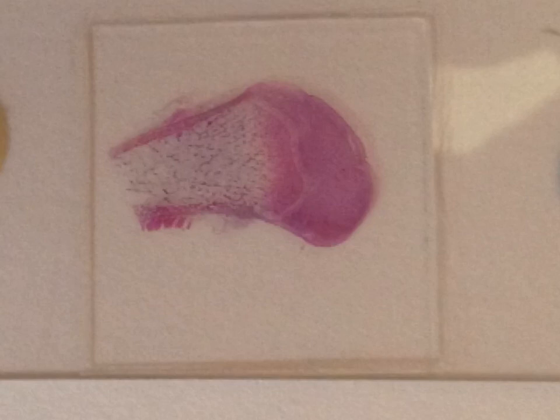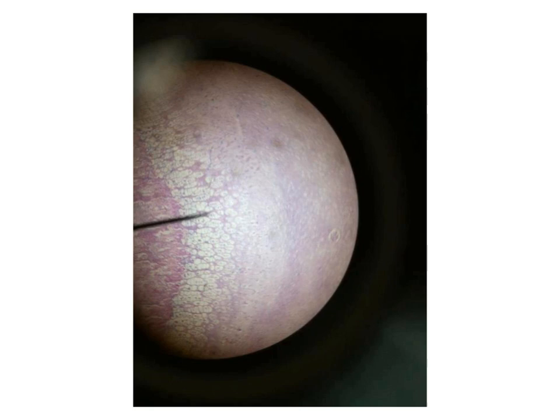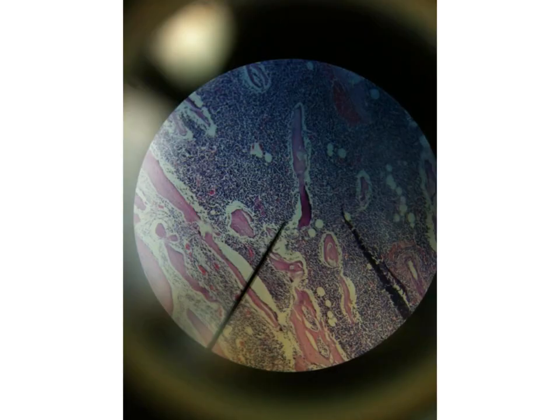So this slide is very characteristic by its shape, but under the microscope you can diagnose almost all the stages of ossification you have taken in theoretical. By looking at the slide under the microscope, you can see the area of the resting cartilage, the area of proliferation here, the area of the hypertrophy, and area of calcification, and here the start of the ossification by formation of the spongy bone.